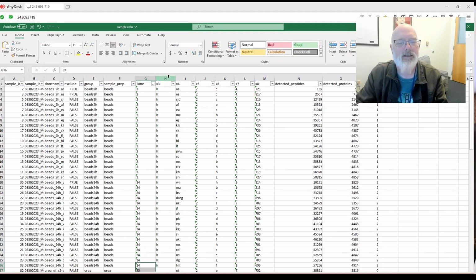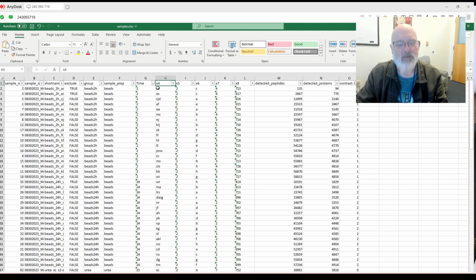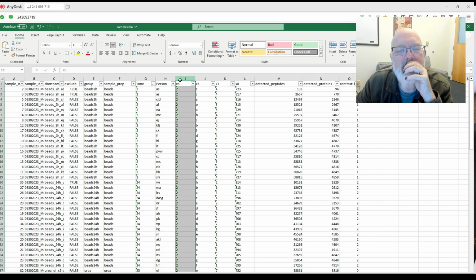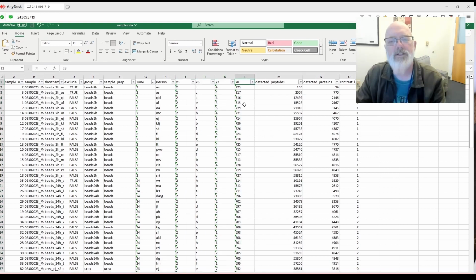And X3 doesn't make any sense, so we'll delete that. And X4 we could say person. These don't make any sense. Okay, so we'll delete these. That's sample. This is run order.